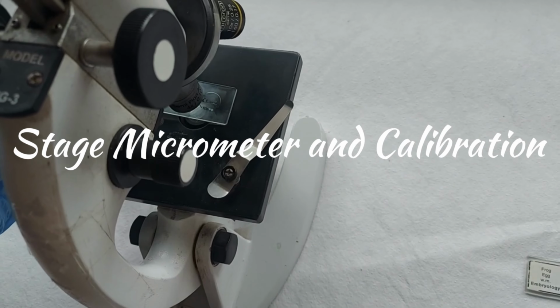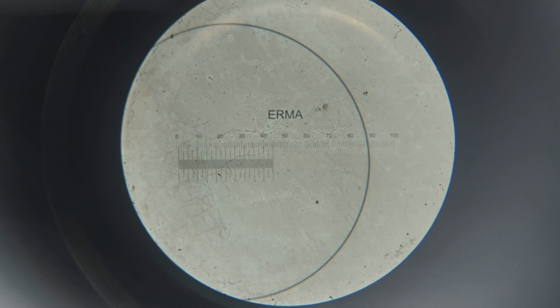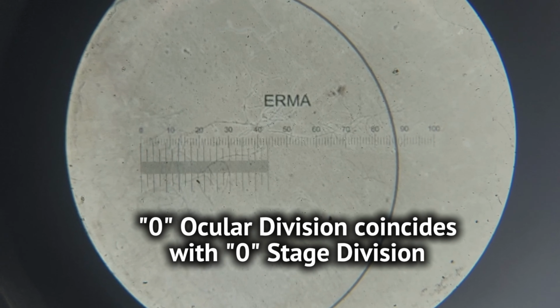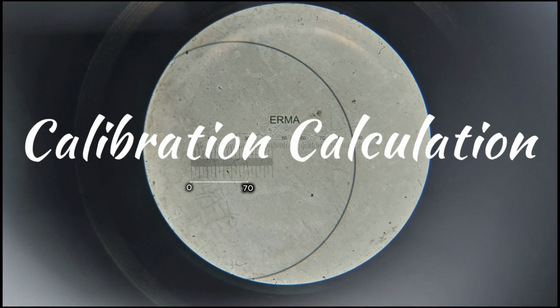Now, the stage micrometer slide is placed on the microscope stage. The microscope is focused carefully so that both the stage micrometer and ocular micrometer scales are visible simultaneously. The eyepiece is rotated until the two scales become parallel. The zero mark of the ocular micrometer is then aligned with the zero mark of the stage micrometer. Further observation shows that 30 divisions of the ocular micrometer coincide with 70 divisions of the stage micrometer.